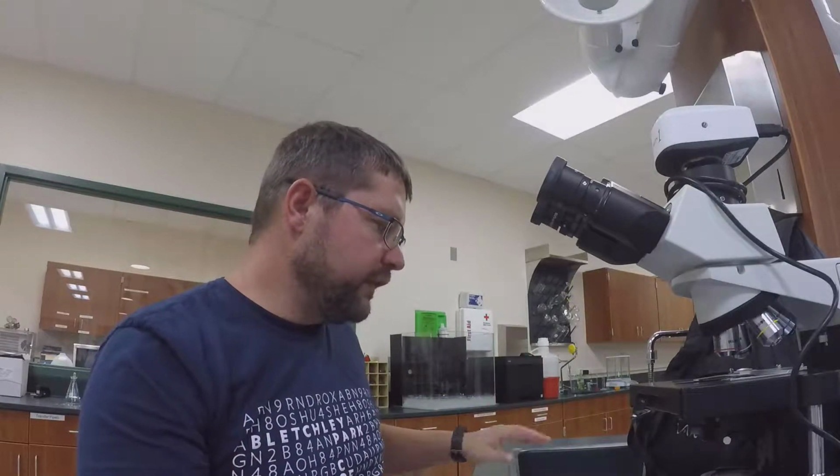So we're going to skip over the individual parts, but the first thing I want to do is introduce you to the 2 types of microscopes that we're going to use in this course.